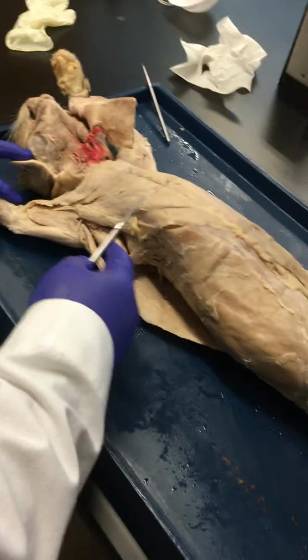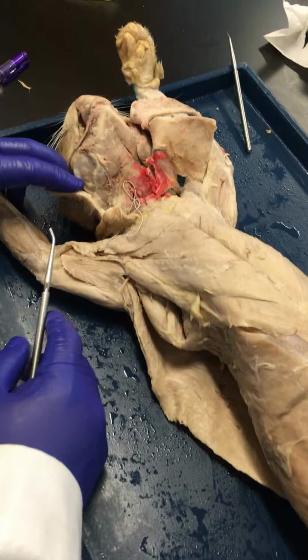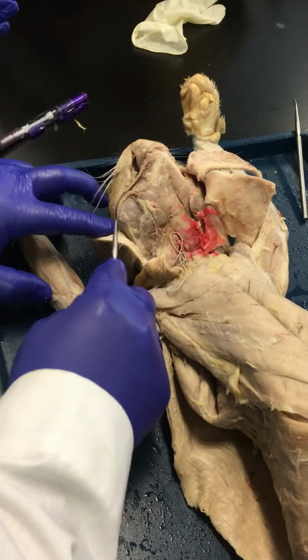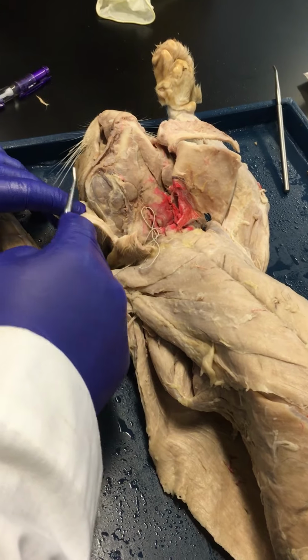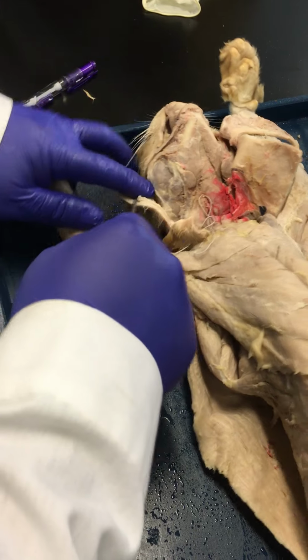We're just going to start where we started with the whole dissection, and that's going to be in the cephalic region. So when we started with this, we exposed the masseter muscle. As you see, your masseter here. And this is going to be a muscle that is going to elevate the mandible, as in chewing. A synergist to this is going to be the temporalis muscle, which is further up, overlying the temporal bone.